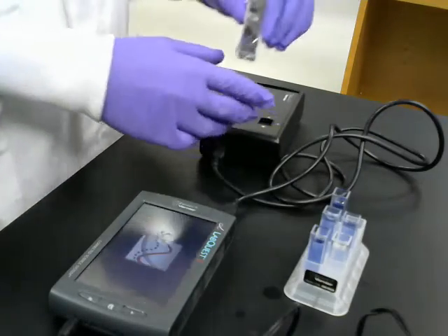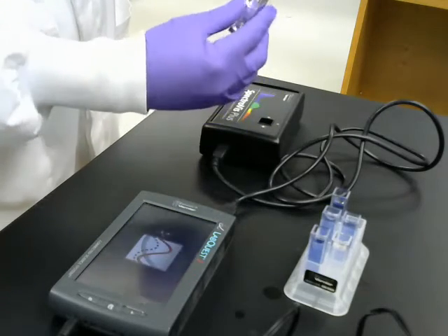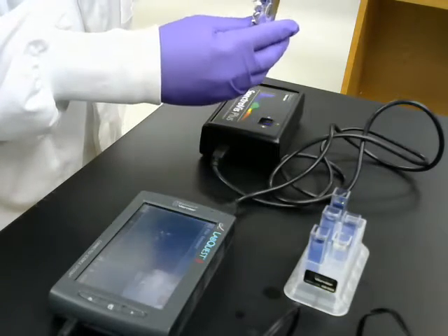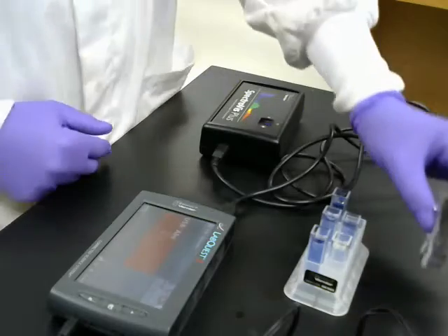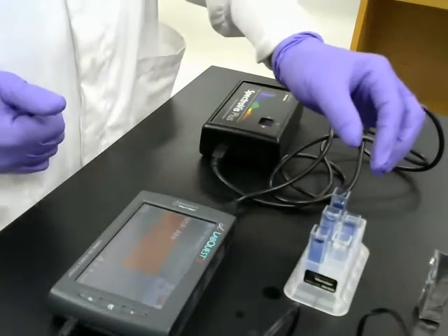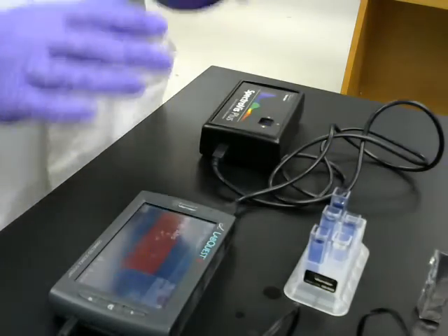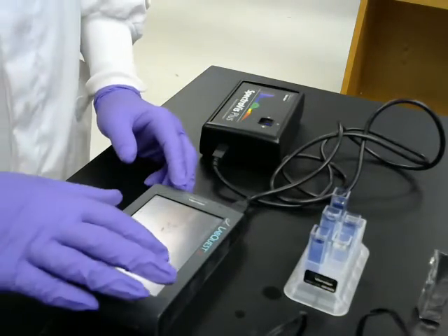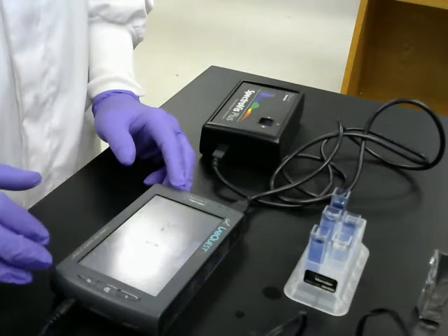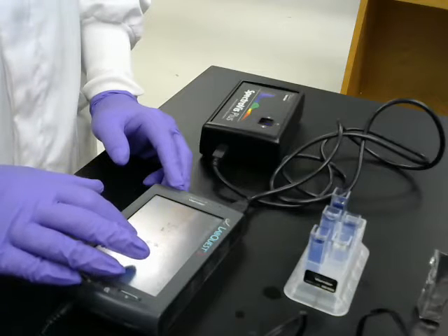in the spectrophotometer. For the dark control, every time I measure it, I'm going to have to pull this out of its aluminum sleeve and put it back in. So that's going to take a little bit of doing. For the others, I'll just add chloroplasts, invert, measure time 0, set it out at its place. Again, when I get this started, it's going to be done in the dark. So I'm not sure how much of that you're going to be able to see on the video. Right now I'm just setting up the wavelength.